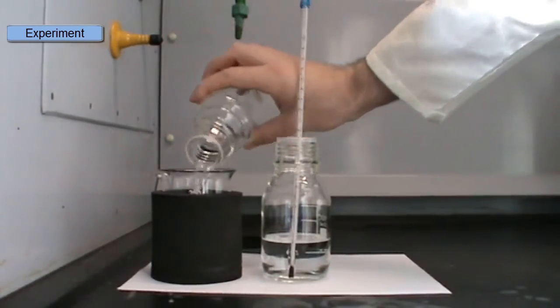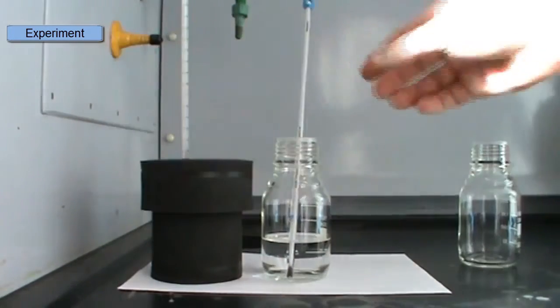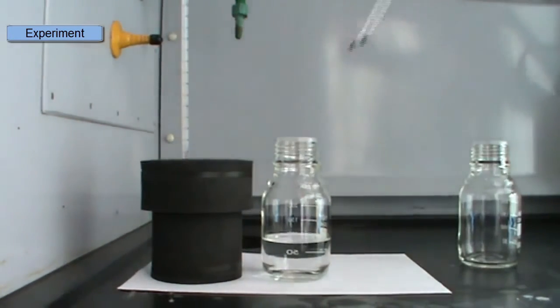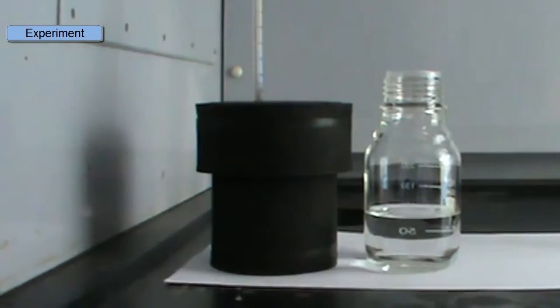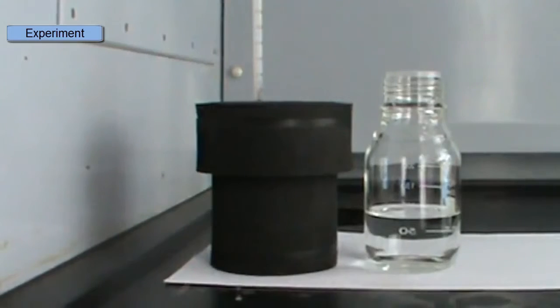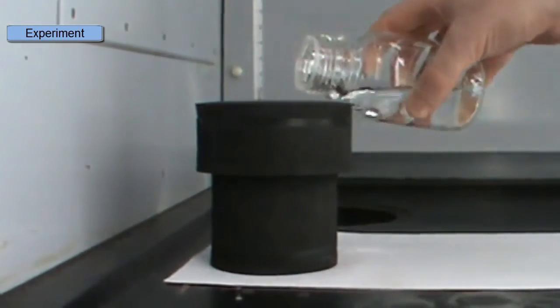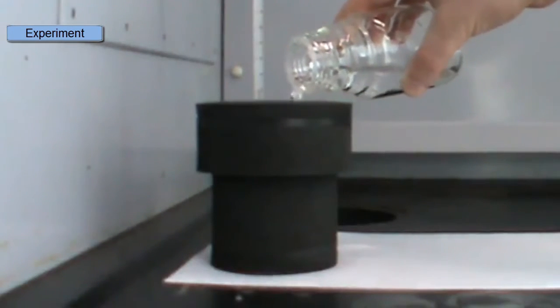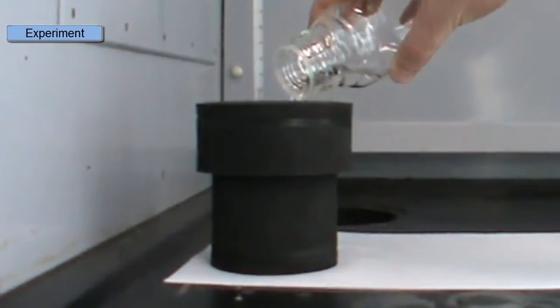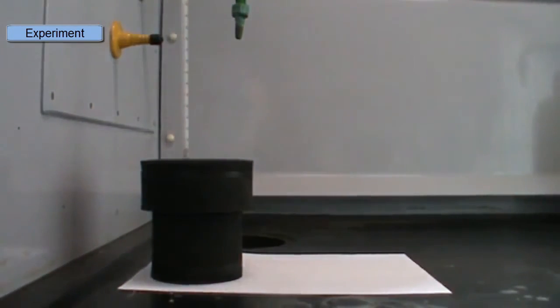And as before, I'll assemble the calorimeter and put in my thermometer before I start. Now I can pour in my acid, and as this reaction proceeds, it's going to form salt and water, and it's going to give off heat. So that heat will obviously increase the temperature of the solution. So we'll pour in our acid, and after pouring in and mixing, we'll note the final temperature. So we watch the temperature increase, and when it levels off, that's the final temperature.